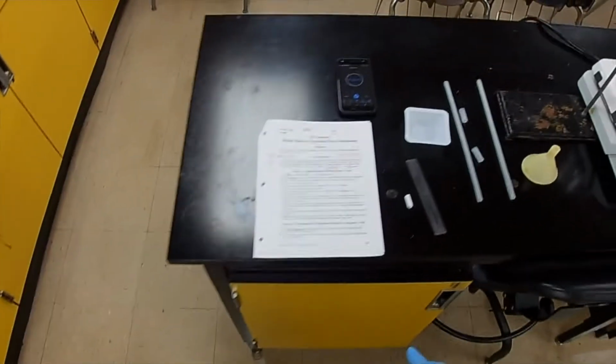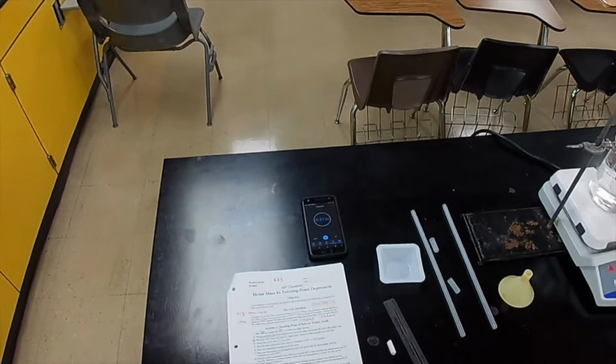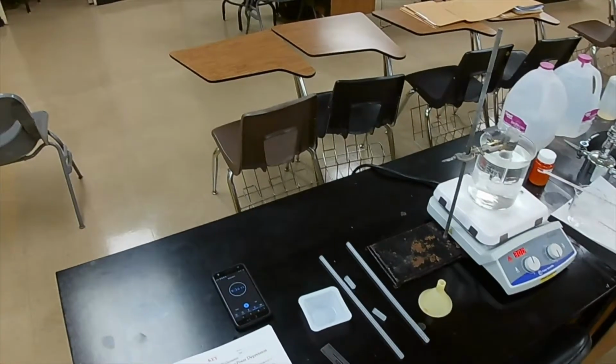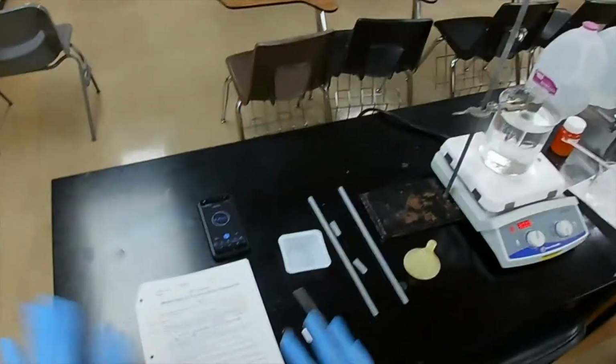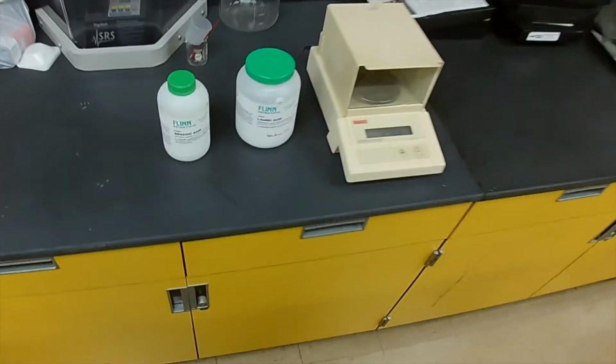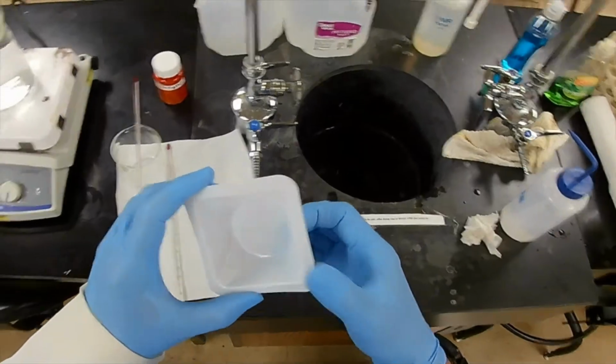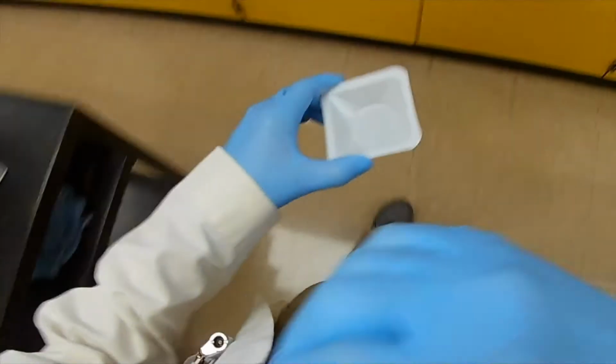We need benzoic acid. Now the benzoic acid is the material for which we are trying to determine the molar mass experimentally. And we're using the freezing point depression to help us determine what that is. Now I'm going to show you how that works as soon as we get all the data. So let's get all the data and then we'll go back to the calculations. So the benzoic acid, let's see if this weigh boat is dry. Yep, it looks ready. Let's get my spoonula out and our benzoic acid. This is pure benzoic acid.